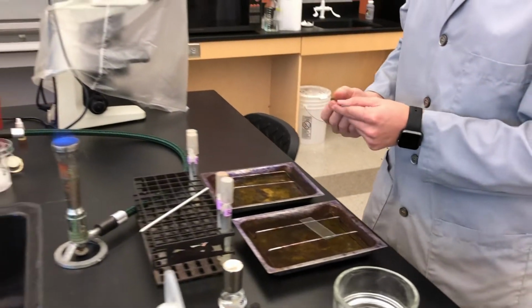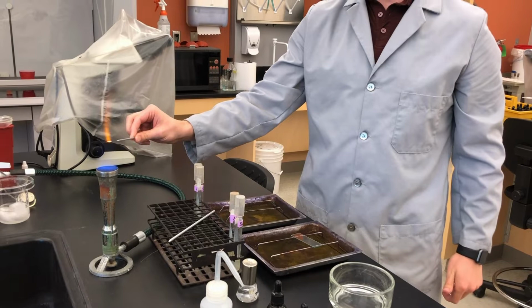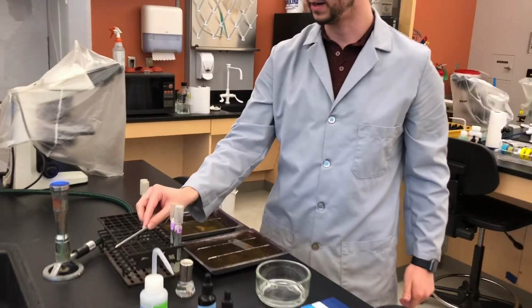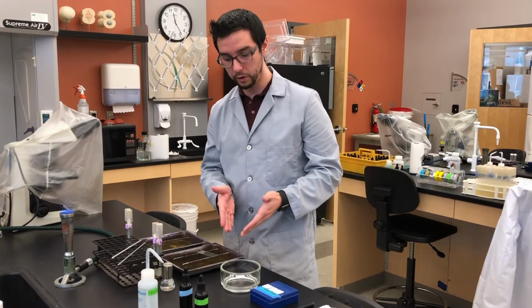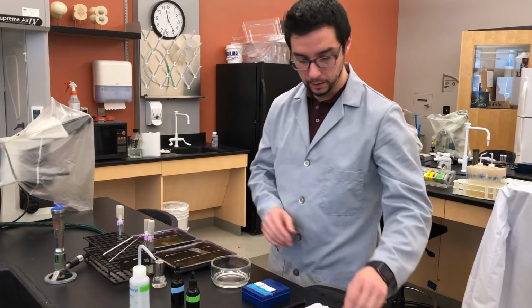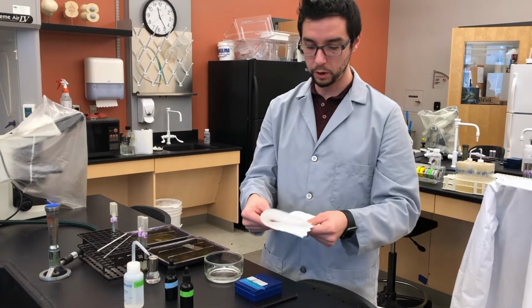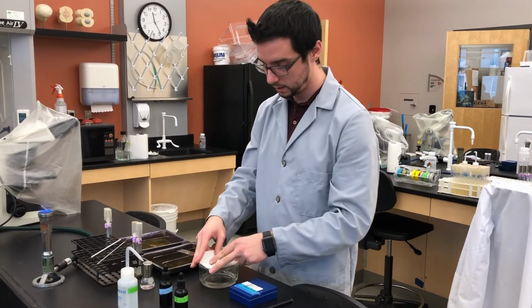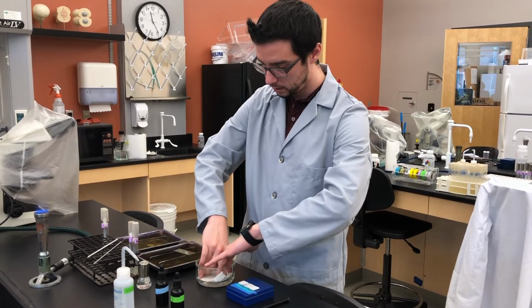All right? And again, sterilize this because you just touched bacteria in that water droplet. Set it down to cool. Now, while we're waiting for those to air dry, we're going to get our microwave apparatus ready. So you're going to have one sheet of paper towel, fold it over twice to form a nice little square. Stuff it down into this glass bowl.